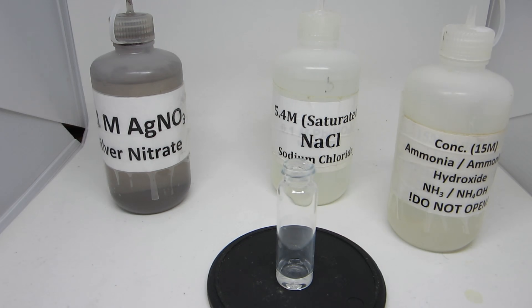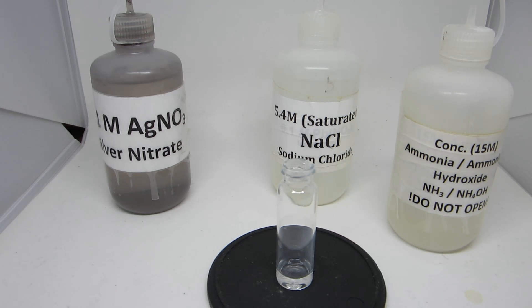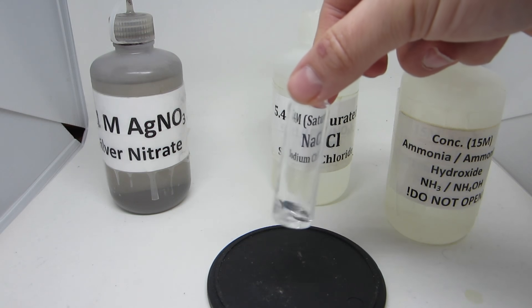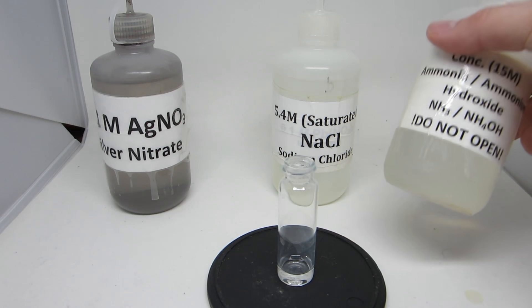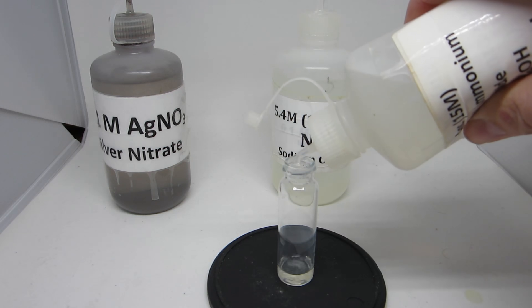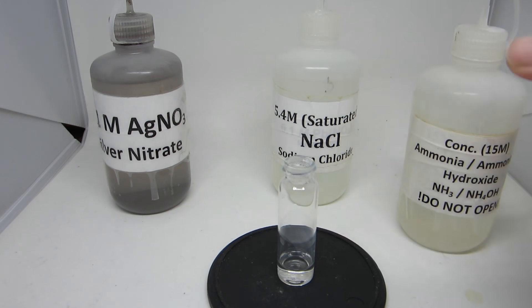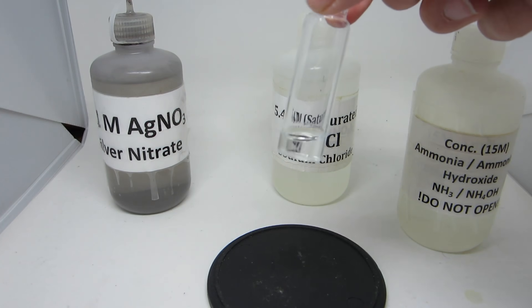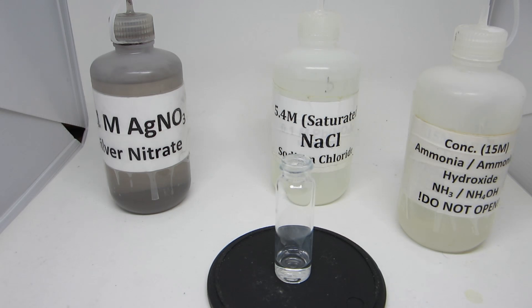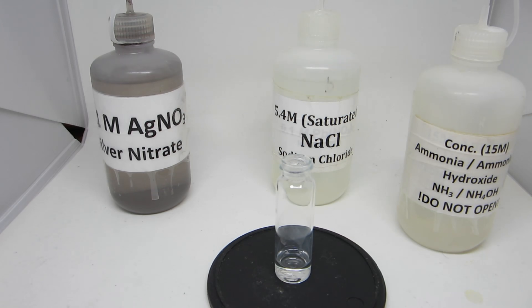In the last step of reaction 11, you are looking specifically at the reaction of silver ions with aqueous ammonia. The silver nitrate solution is clear and colorless, as is the ammonia solution. When the two are mixed together, there is a slight precipitation and then ending with a clear and colorless solution. The question is, does a chemical reaction take place in this reaction, and what would be complexing with the silver?